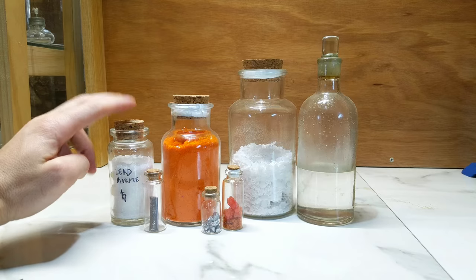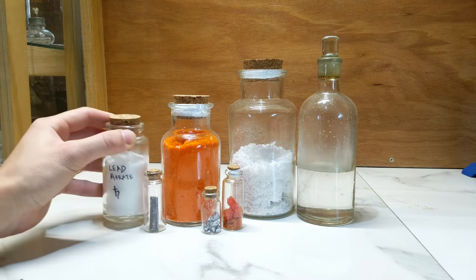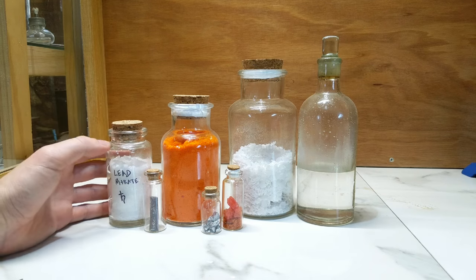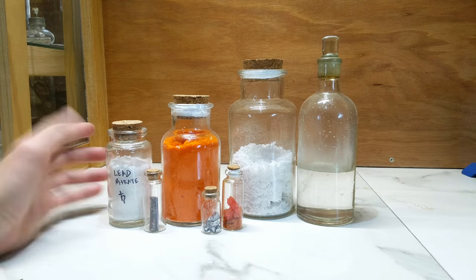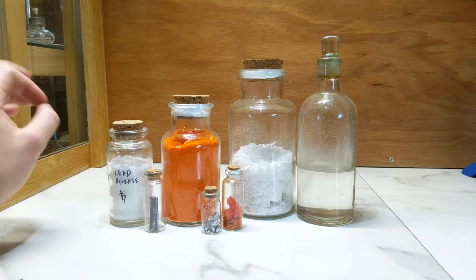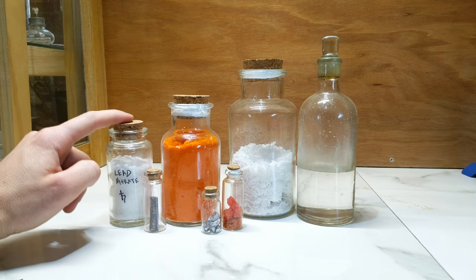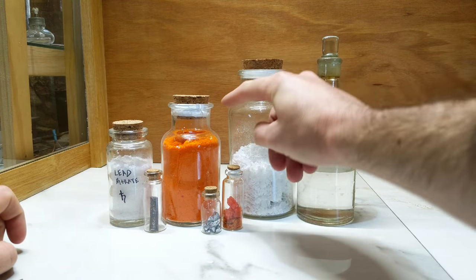So we'll be taking our lead source, which ultimately just has to be a soluble lead source, so you could also use lead acetate or sugar of lead, which I shall make some in amongst this series to see if there's any difference between the two. And we'll be taking that and combining it with a chromium source.